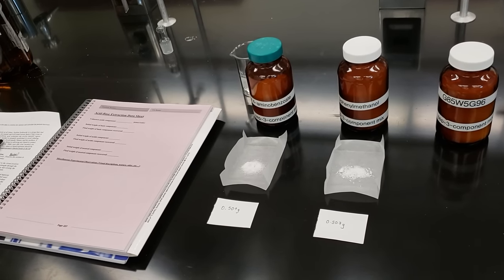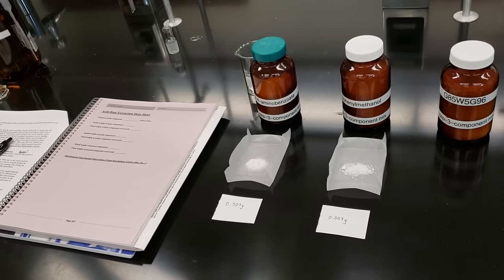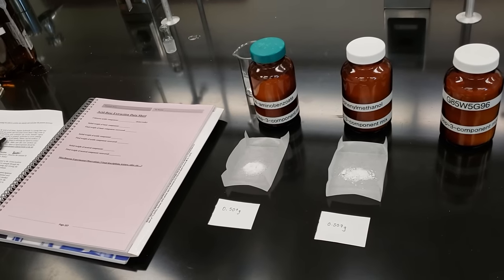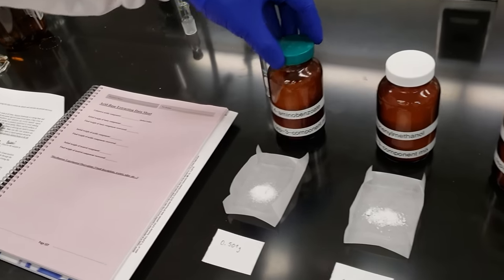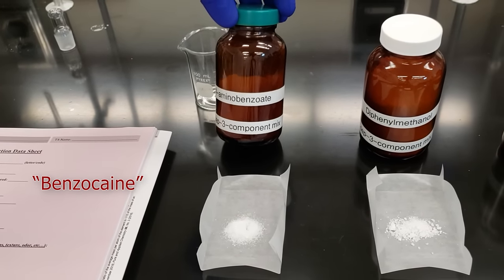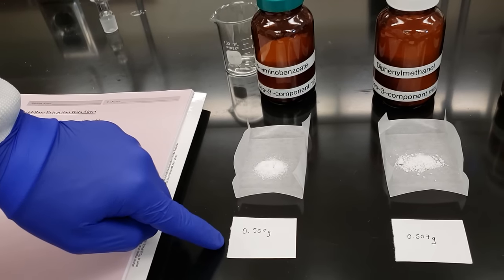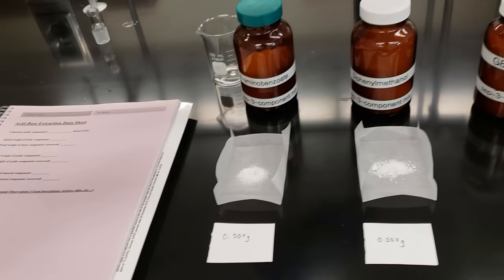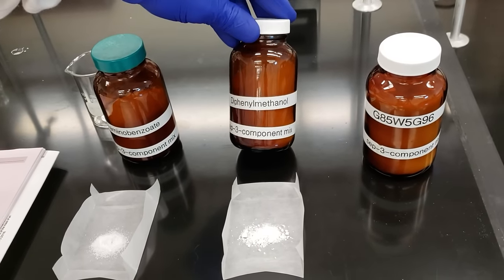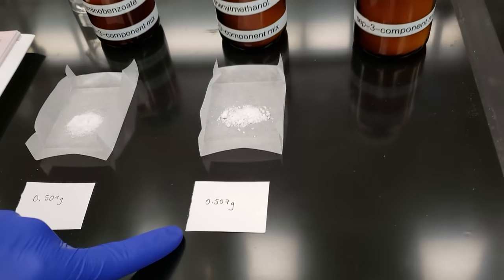Chem 2211. This is separation of a three-component mixture using acid-base extraction, which is a specific version of liquid-liquid extraction. For this experiment, we have three components. We have our basic component, which is ethyl-4-amino-benzoate — we've already weighed out 500 milligrams, 0.501 grams. We have our neutral component, which is diphenyl methanol, weighed out at 0.507 grams.